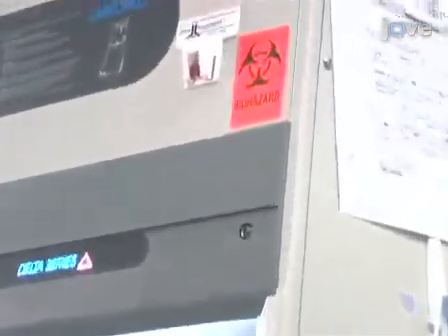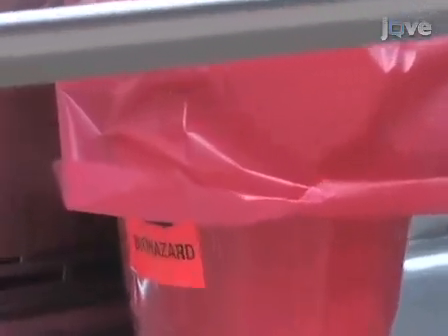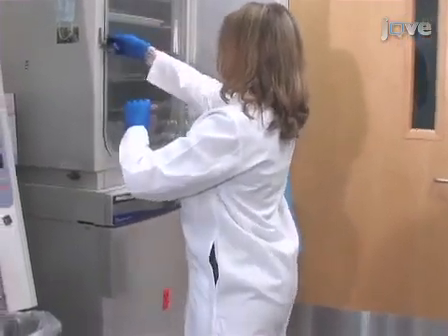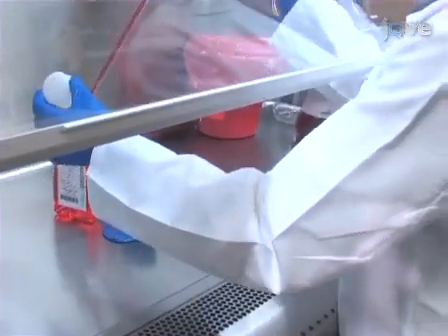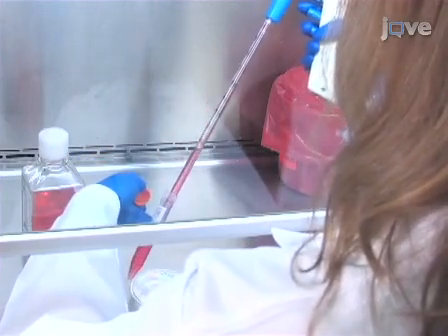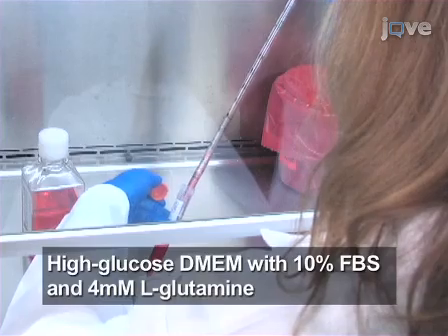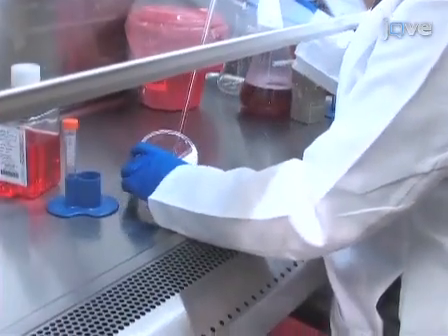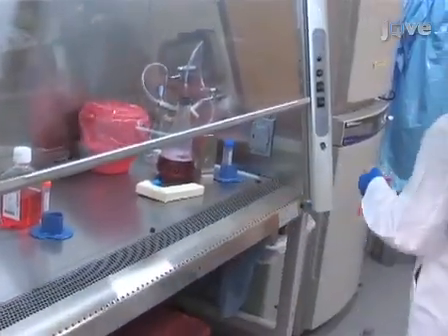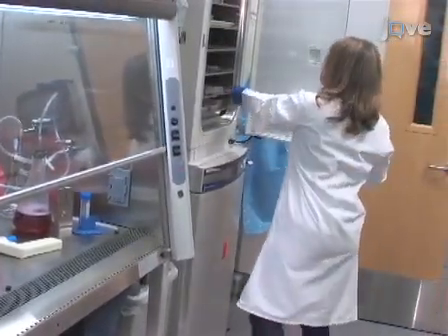Before beginning this procedure, consult your institutional safety official and follow their recommended safety guidelines. Begin with a culture of healthy, rapidly growing 293T cells. Working in a tissue culture hood under aseptic conditions, resuspend 5 × 10⁶ 293T cells in 10 ml of antibiotic-free 293T medium. Pipette the cell suspension into a 10 cm tissue culture plate and incubate the plate overnight in a tissue culture incubator at 37 degrees Celsius and 5% carbon dioxide.